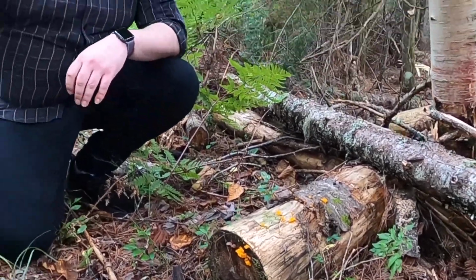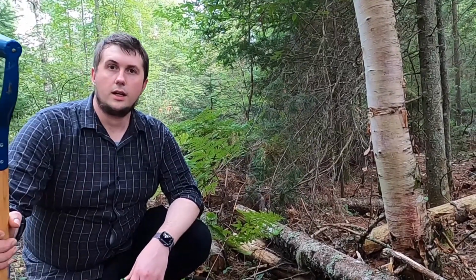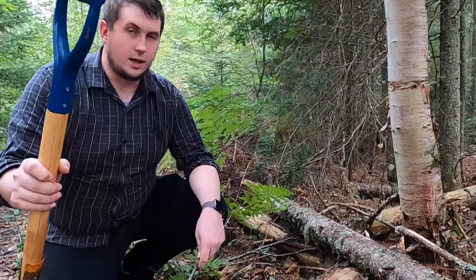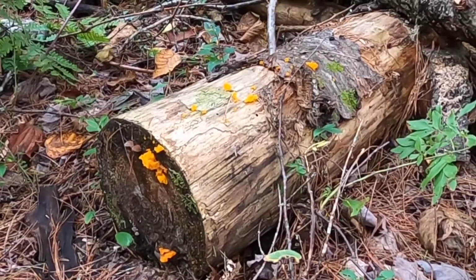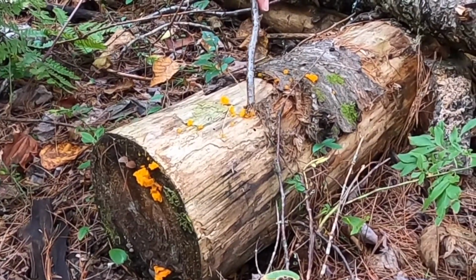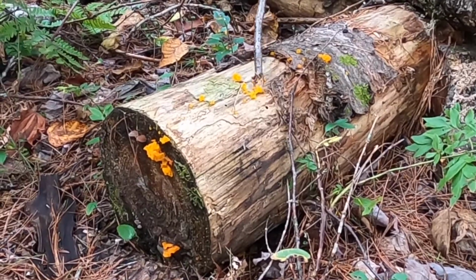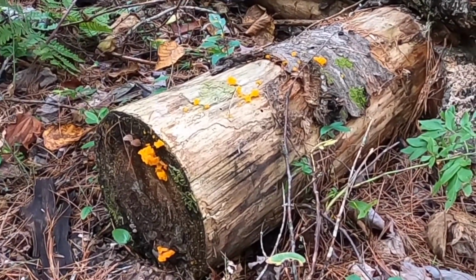So among the tremendous diversity of different types of fungi, there's fungi that don't look like ordinary mushrooms at all. One example that's pretty common in the woods around here are these jelly fungi, and these have a really kind of loose consistency or texture. If you poke them, you'll see they're very loose aggregates, and they have this bright yellow color from natural pigments that the fungi produce.